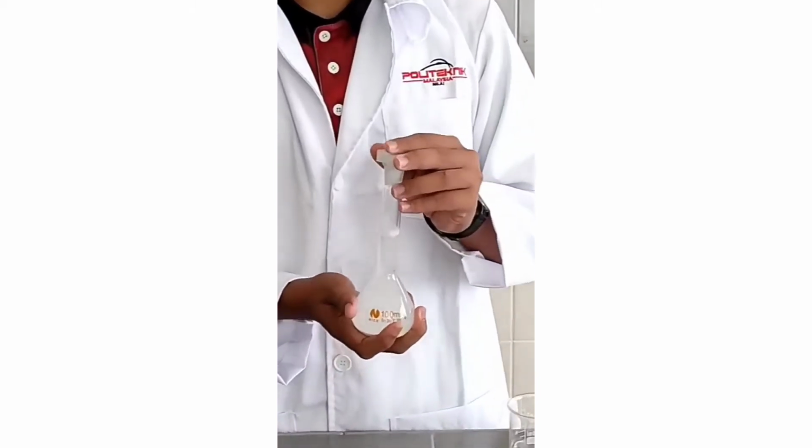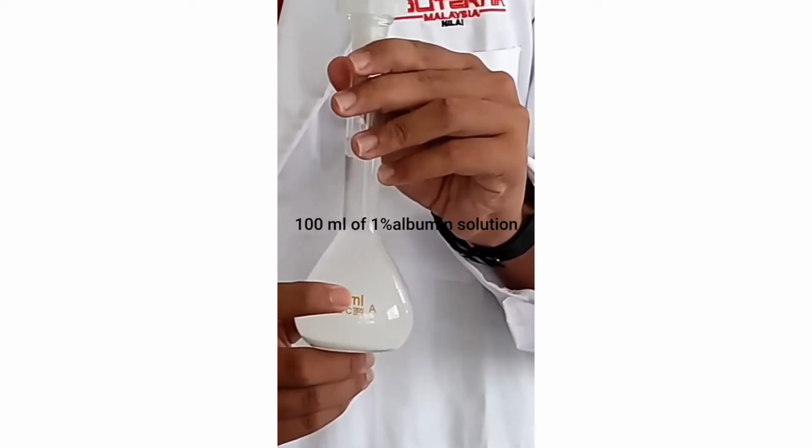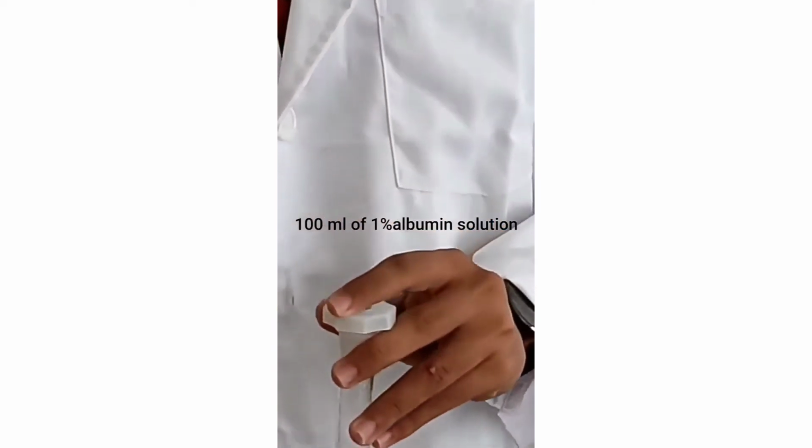Now we have finished preparing the solution. We have prepared 100 ml of 1% albumin solution. Okay, that's all for the experiment.